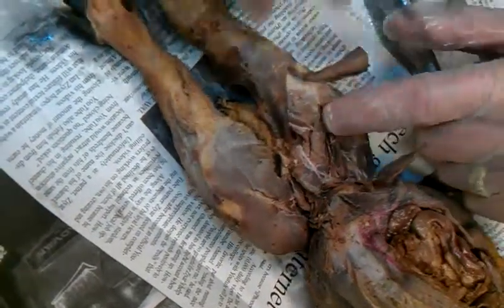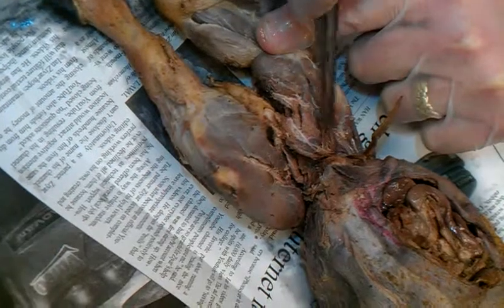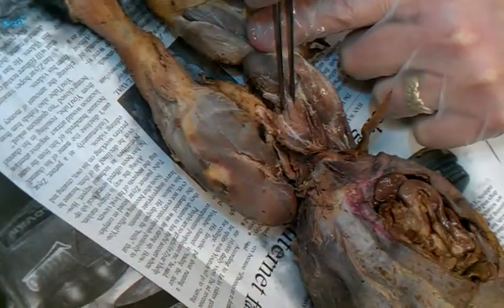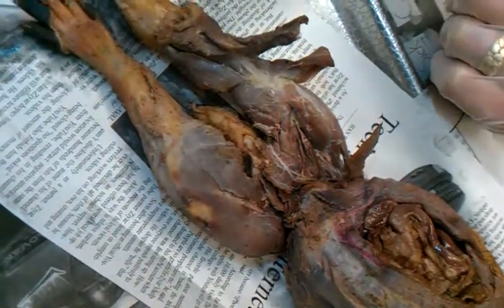And then there's a mess — the semi-membranosus just kind of comes apart. You can make it into a million muscles if you wanted to, so just find your separations and then keep them there. And then this would all be semi-membranosus. So adductors — what function do they do? What does adduction mean?